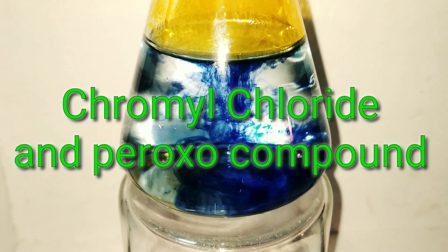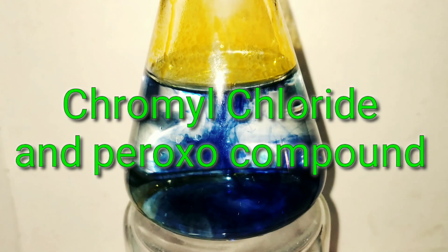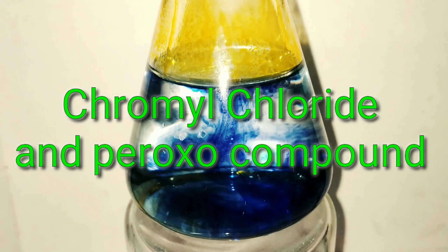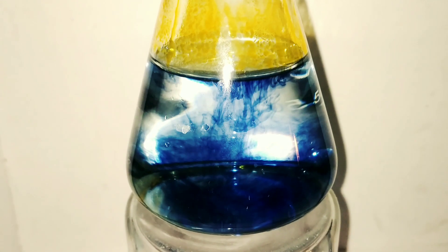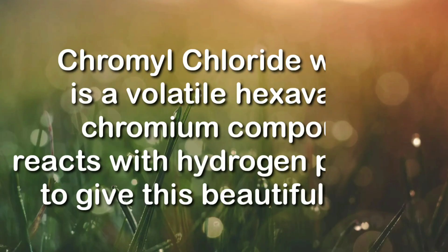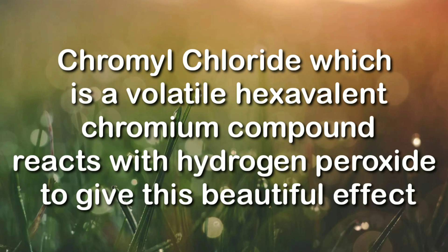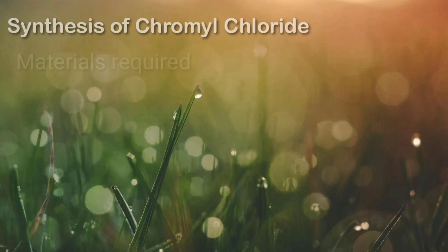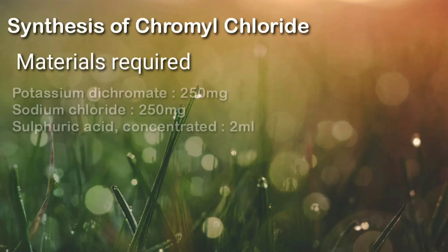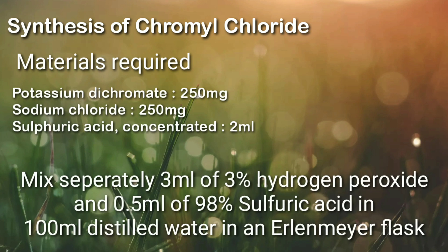Today we would be synthesizing chromyl chloride and its peroxide compound. Chromyl chloride is a volatile hexavalent chromium compound, that is chromium 6+.